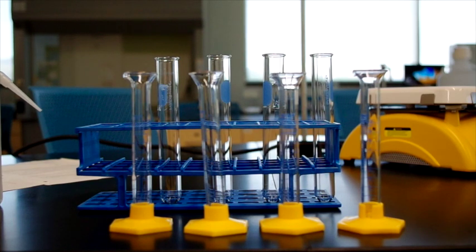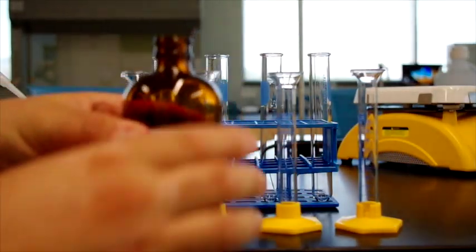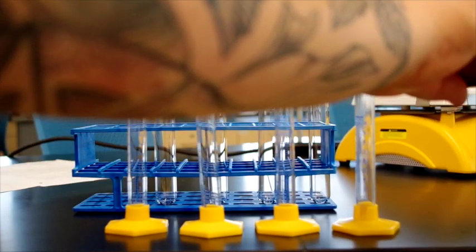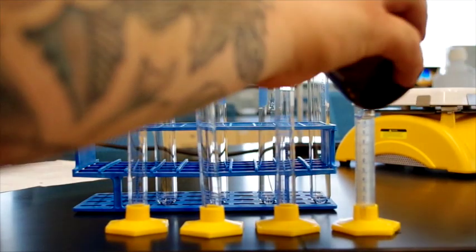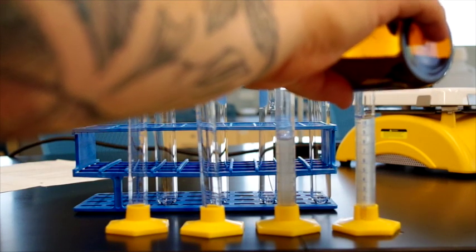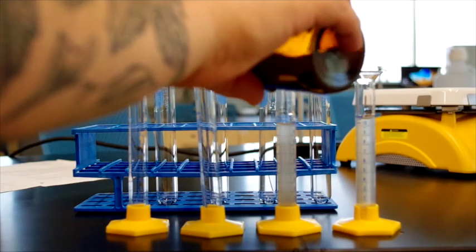Alright, now we're going to do part D of the soluble and insoluble salts lab, which is the purification of water, and we will begin this by measuring out 4 10 milliliter quantities of muddy water and adding them to these test tubes. So this is muddy water. You'll see how muddy it is here in a second. It's pretty gross. I would never drink this if I were you.